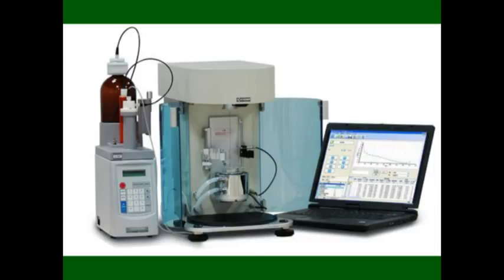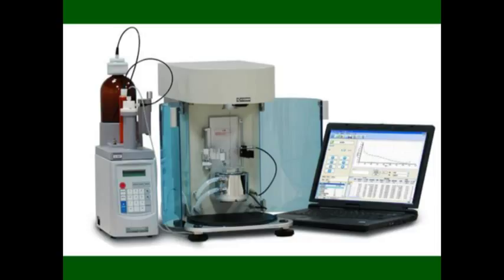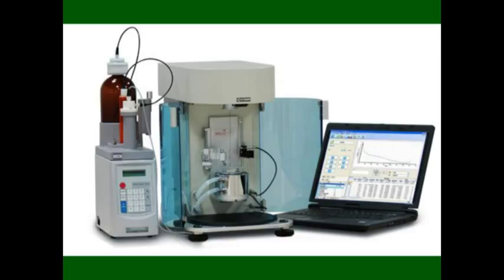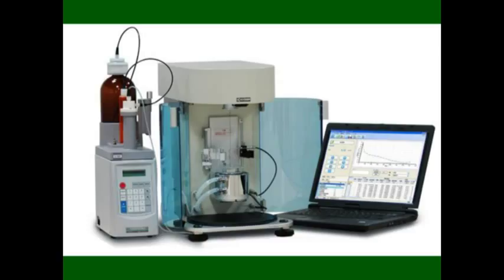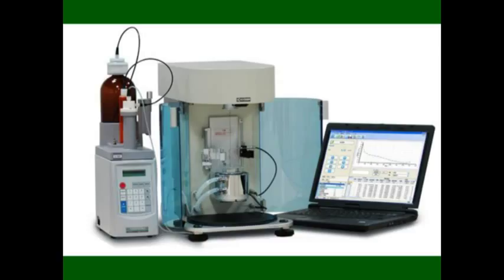If you have watched our surface tension video, you are familiar with our concept of the Wilhelmy plate and surface tension measurements. Let's take a look.